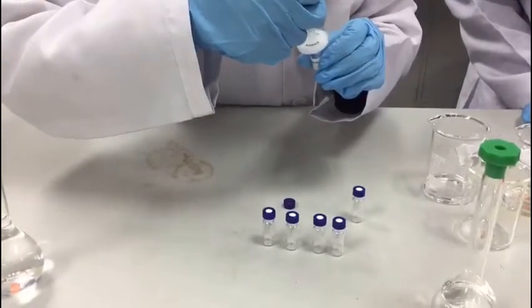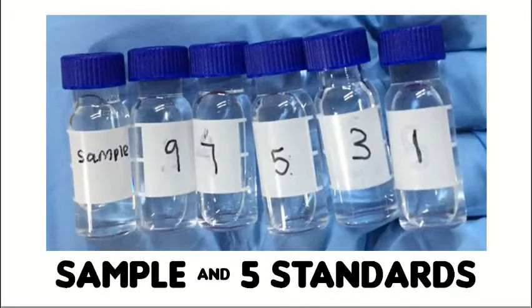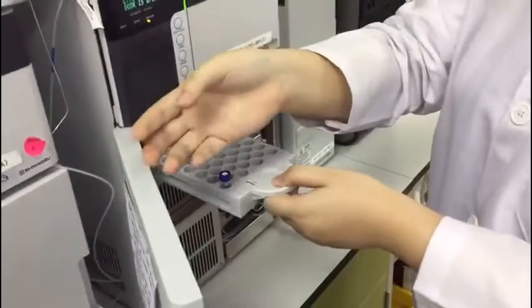Now we will proceed to the equipment to conduct the HPLC system. Then we put all the vials of the sample and standard into the injector system.